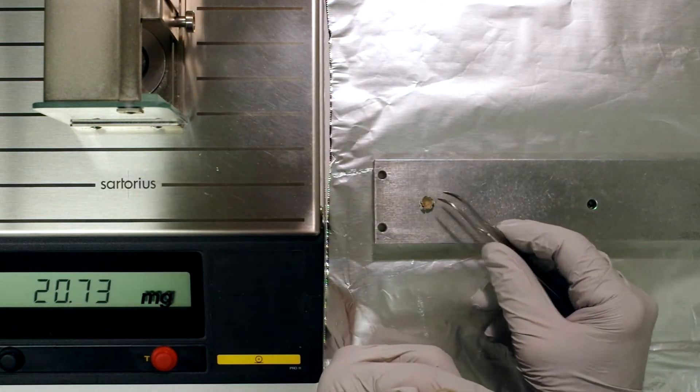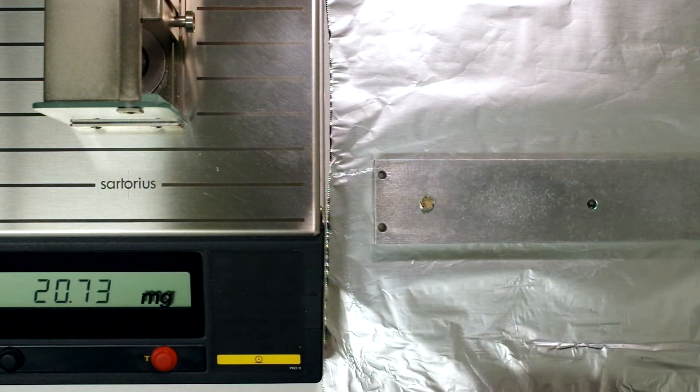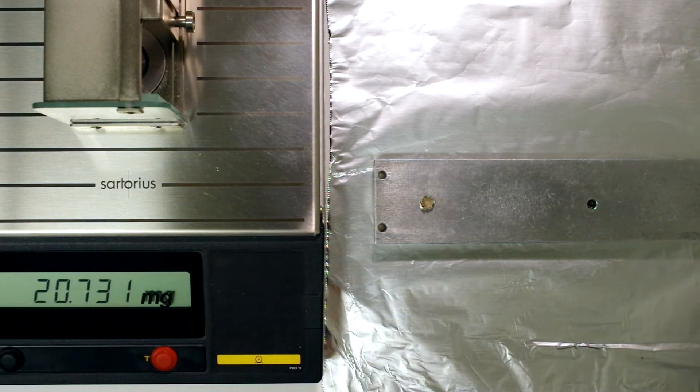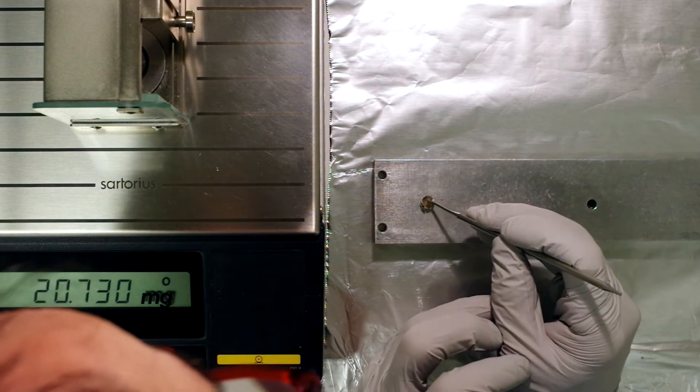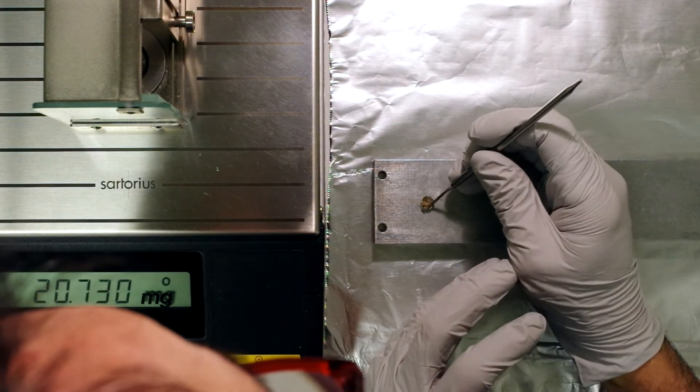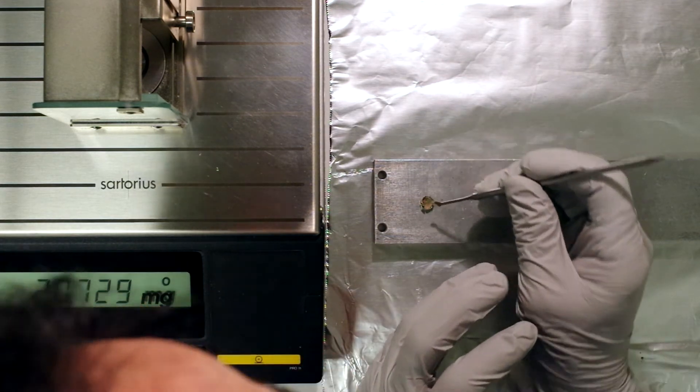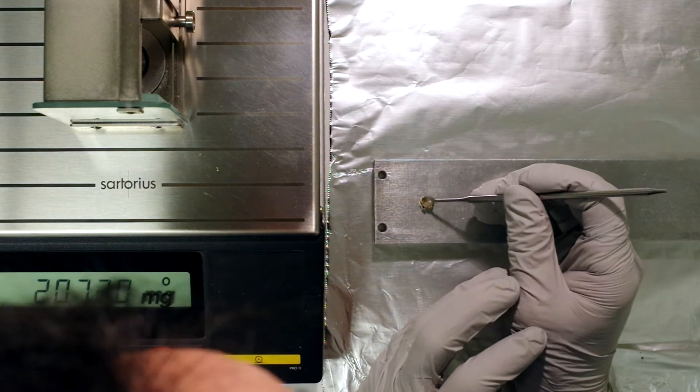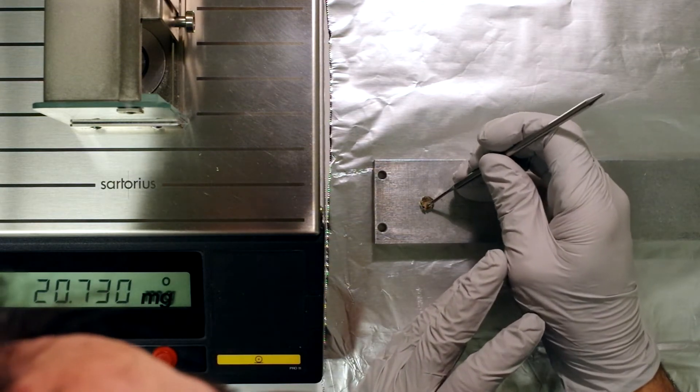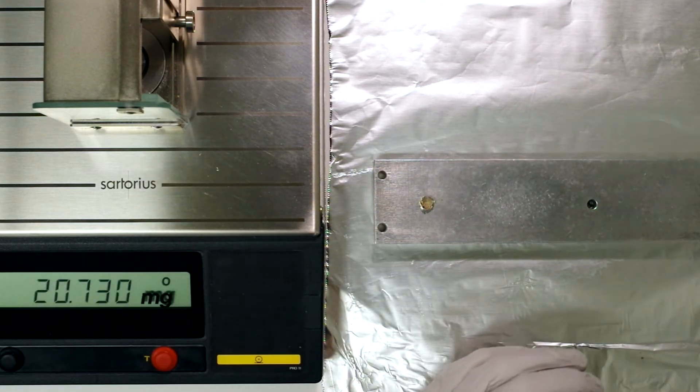So I'm going to seal this up. You need to seal it very carefully so that you don't puncture the tin capsule. I'm going to push the material in on the sides so it doesn't spill out. What I want is a sealed capsule where none of the material spills out of it.